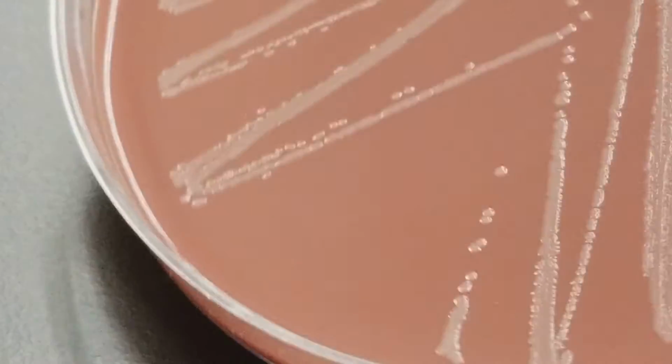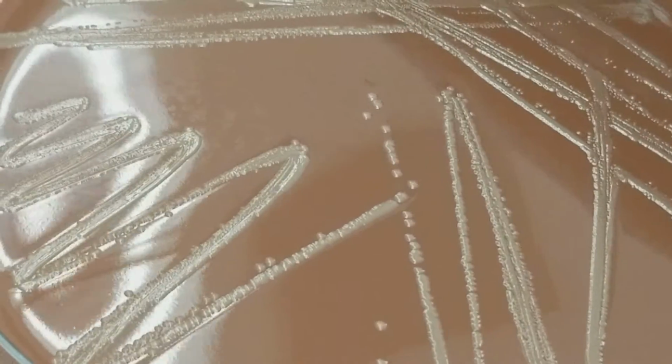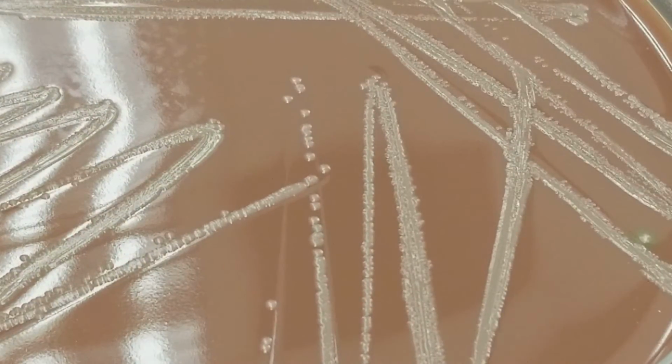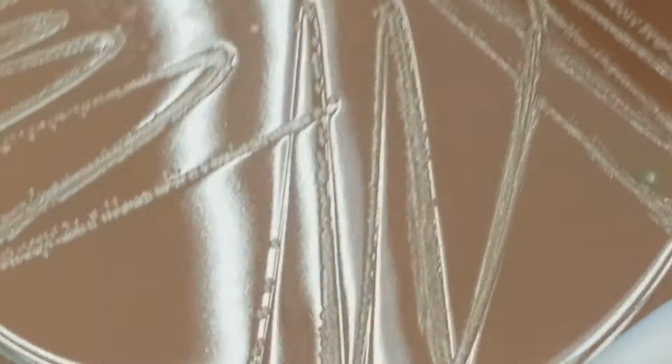All right, this one is from a sputum. There's that distinctive smell. This one only grew, or will grow, on the chocolate agar plate. So that means it's fastidious and it is a finicky eater. And the main one that we're thinking about with that would then be your Haemophilus. Okay, we don't really have what this is here. It could be influenzae, Haemophilus influenzae, or para-influenzae. But this is what Haemophilus looks like.